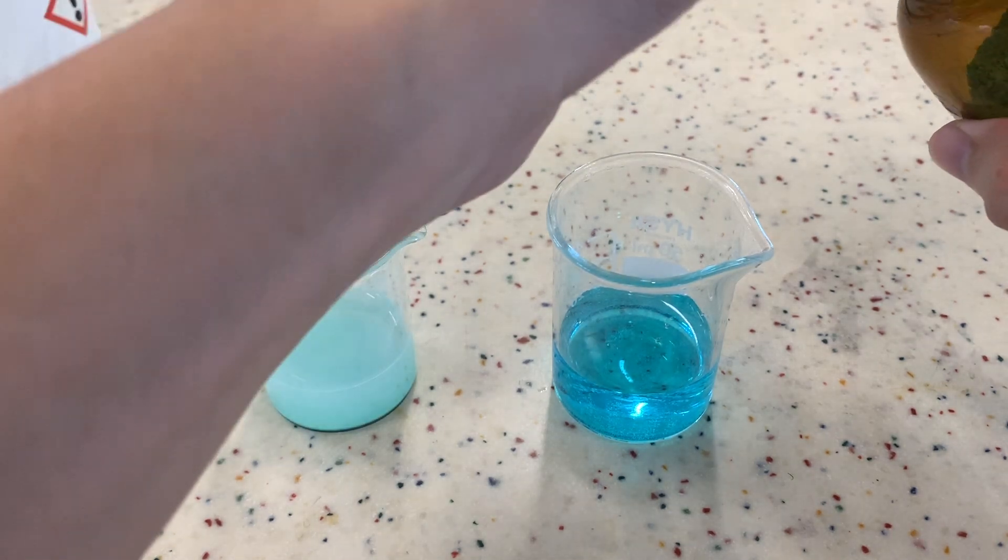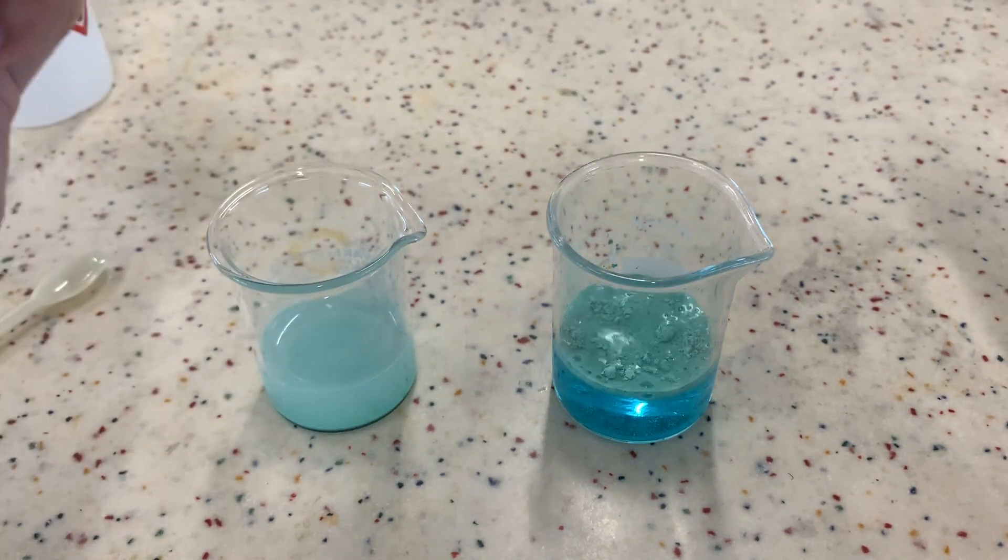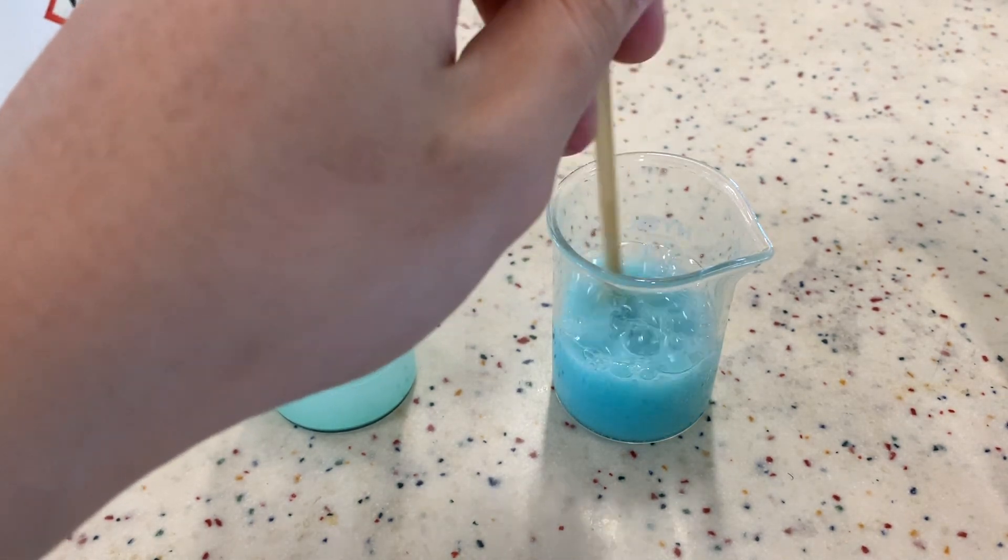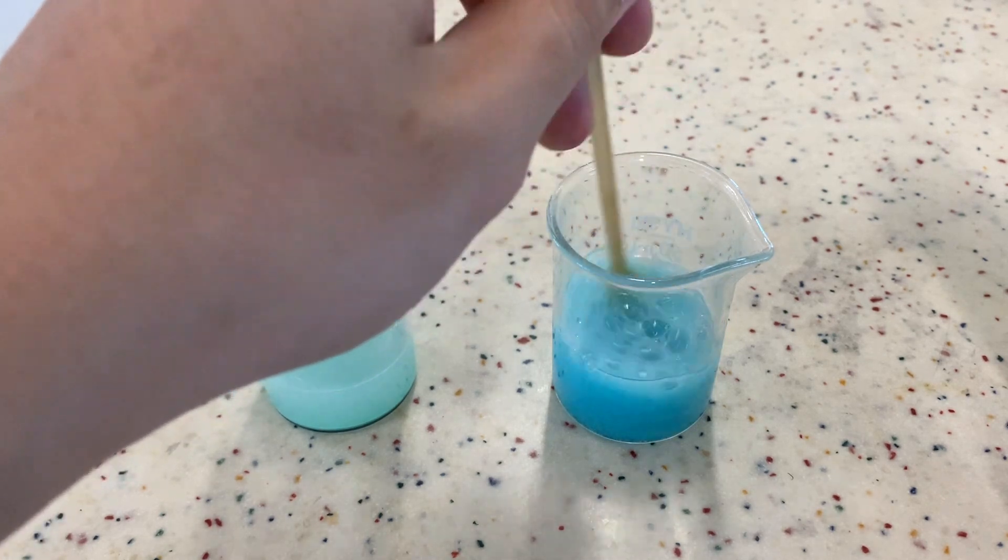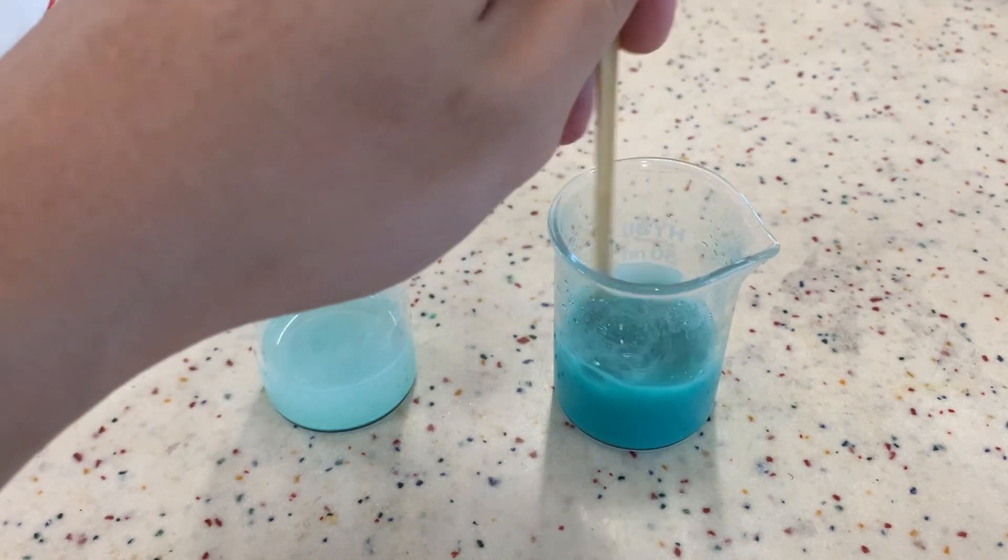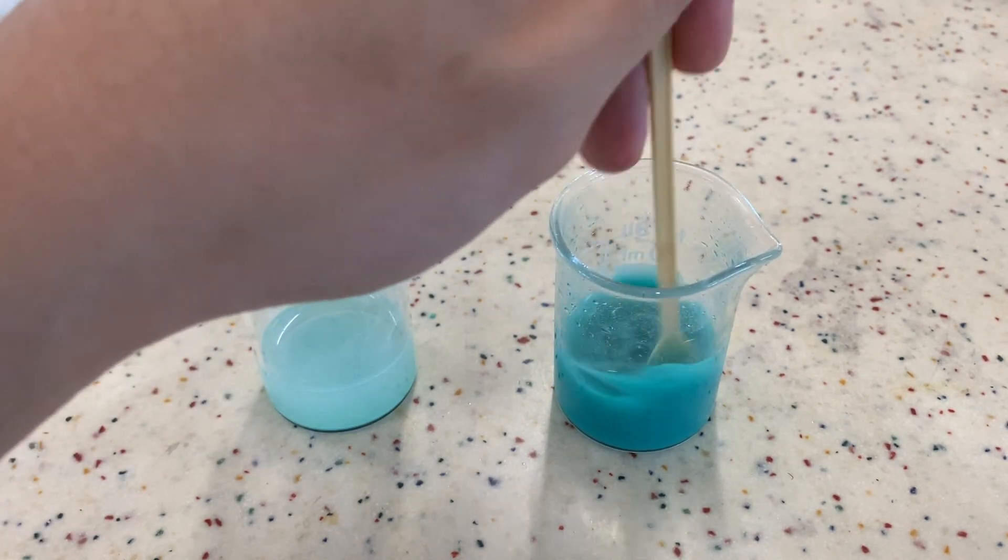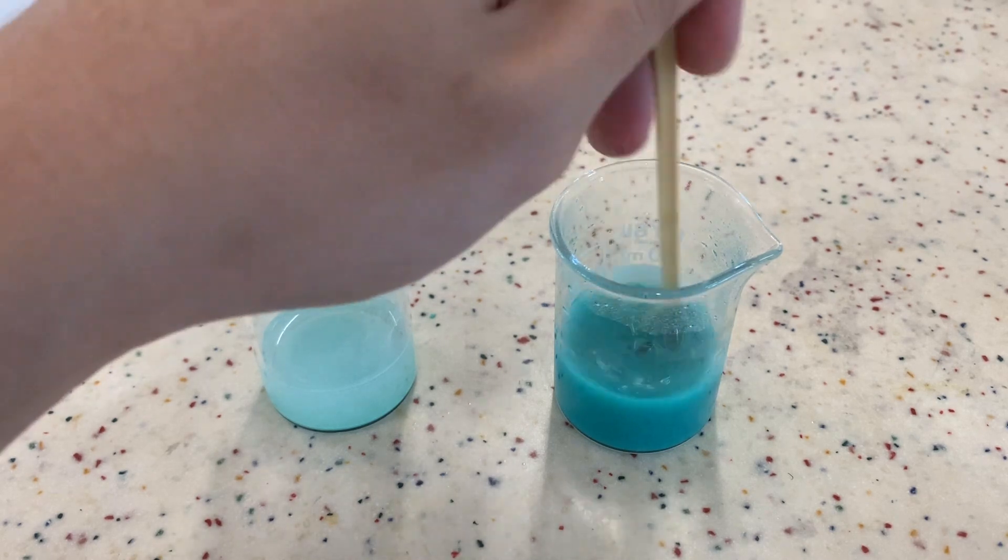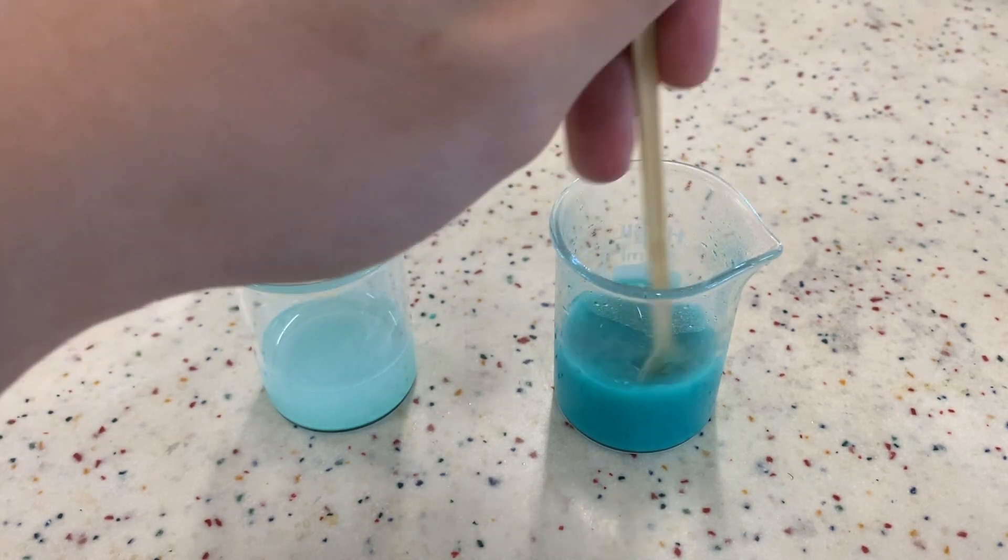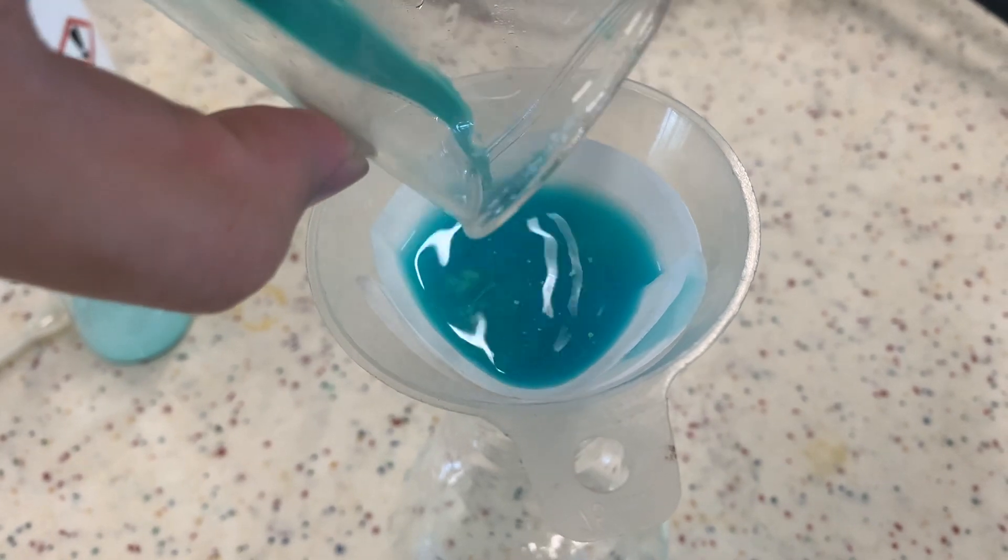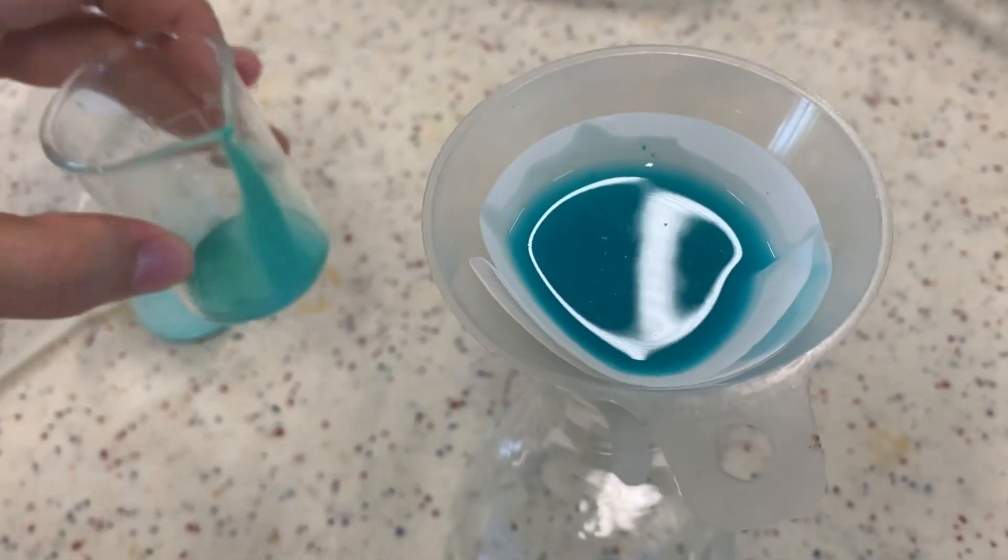Well, when I add more carbonate, I'm reacting away the excess acid. And when I add the carbonate in, I see bubbling. That's where I know that there's still acid that's unreacted there. I do not want the acid in my salt because it is very difficult to separate from the salt later on when I just want copper 2 sulfate. At this point of time, it seems like I've added an excess of copper 2 carbonate and all the acid in the beaker has been reacted already. But now I have a mixture of insoluble copper 2 carbonate and copper 2 sulfate that I've just made. How can I separate them? We filter the mixture to remove the excess copper 2 carbonate and we'll get copper 2 sulfate as the filtrate.